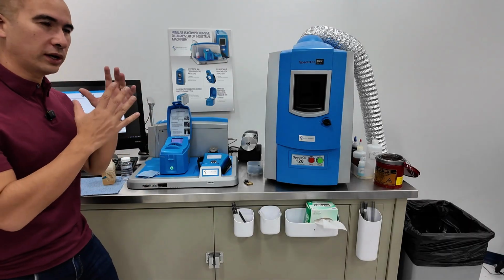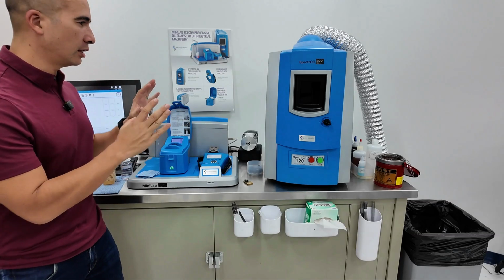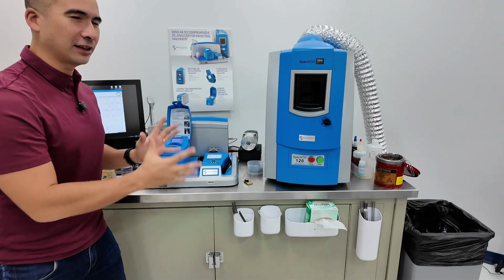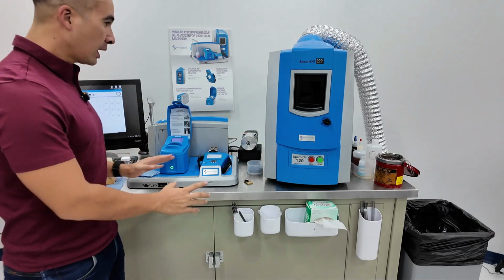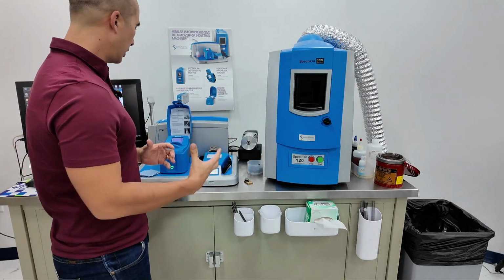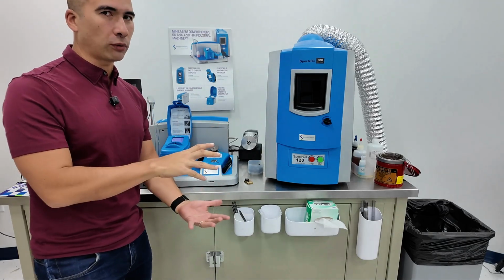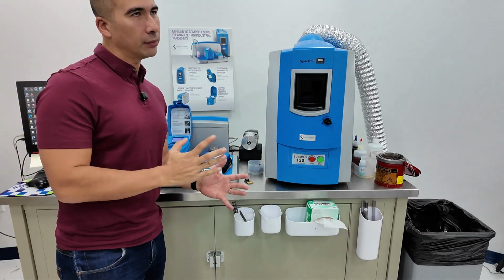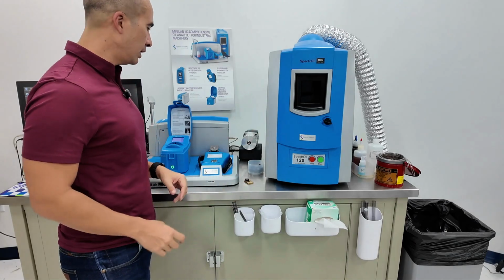All right, so now we're looking at what is the MiniLab setup. That's an interesting naming convention, because the MiniLab is mini relative to a usual lab, but it is larger than the FieldLab. So mini is relative to a third-party lab, right? The difference between this and the field labs is that this is a little more modular. The field labs are in a Pelican case and all mil-spec rated, so you can take it into the field, dust and contamination is not as much of an issue, and if you drop it, it's not ideal, but it will probably survive. This is more made for benchtop activity, but it is still portable.